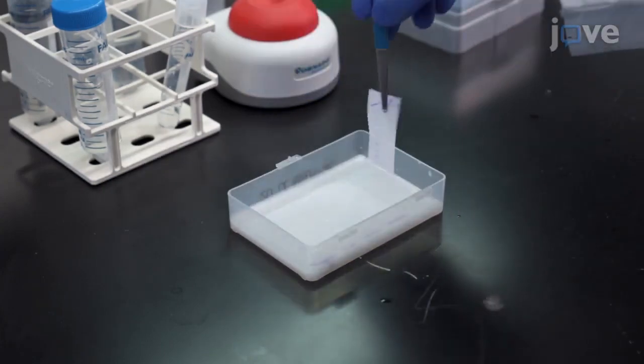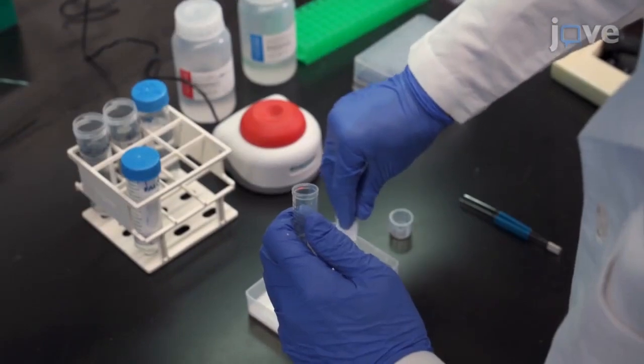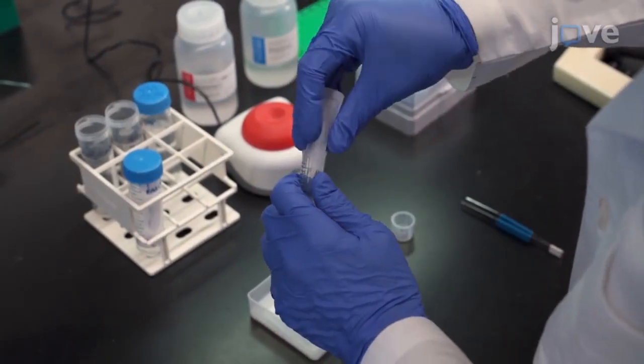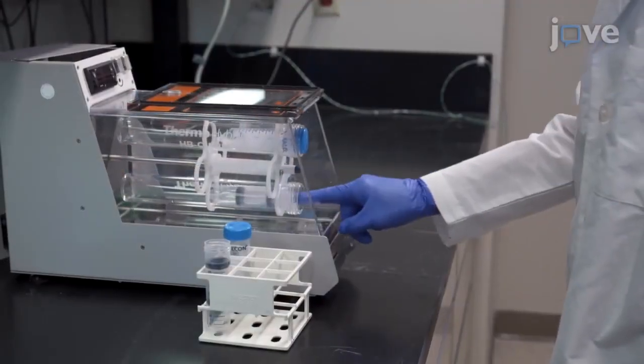Using the combination of immuno-enhancing technology with cyclic draining and replenishing, once you've got a blocked membrane, the entire procedure can be accomplished in as little as 20 minutes without sacrificing sensitivity.